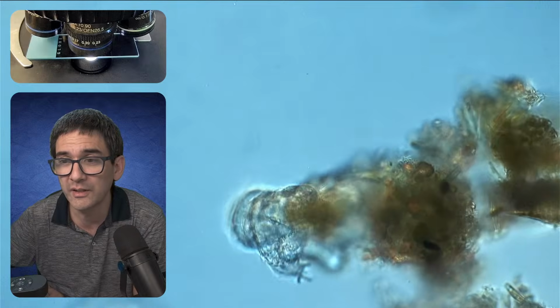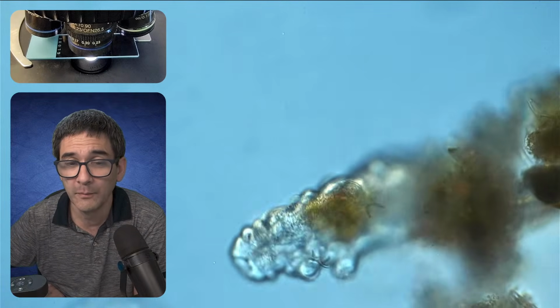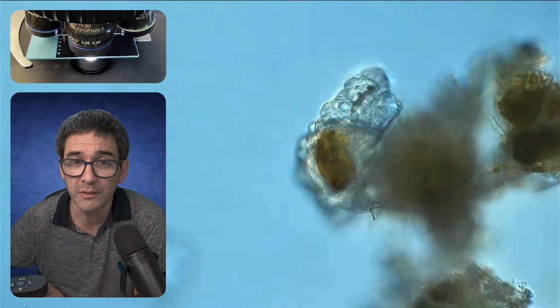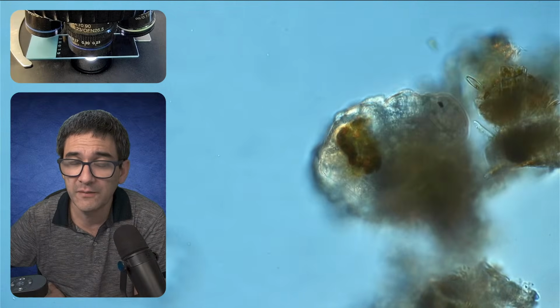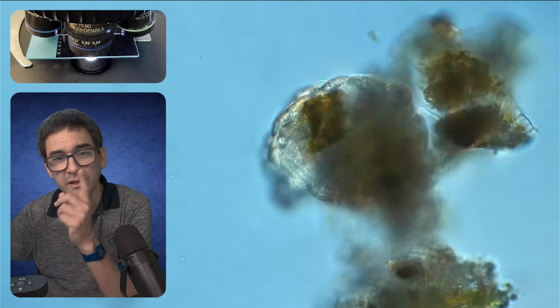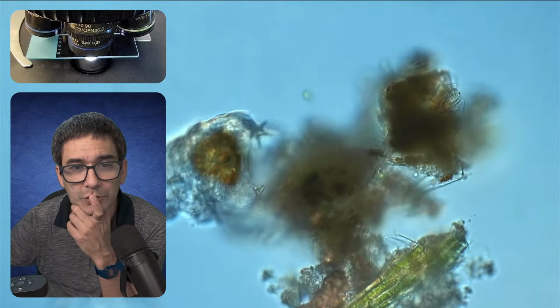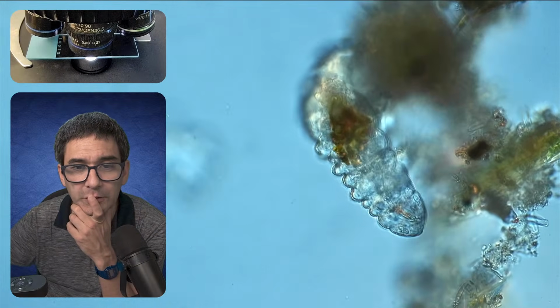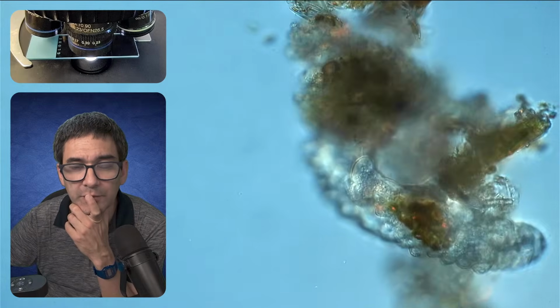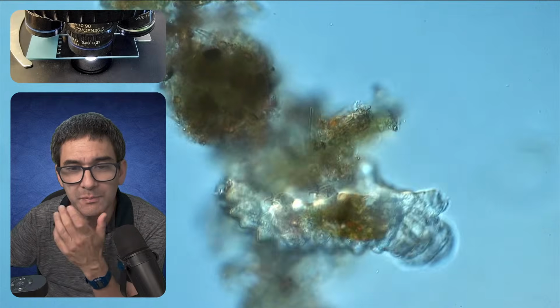There's still more questions than answers when it comes to microbes. The more we know, the more questions appear. And for me, it's fascinating how, just another thing, when we look at this creature over here, sorry if I'm getting a little philosophical again, we immediately realize that it's alive, right? Everyone would agree, yeah, it's alive. But how do you know? And the reason is because it moves, right?